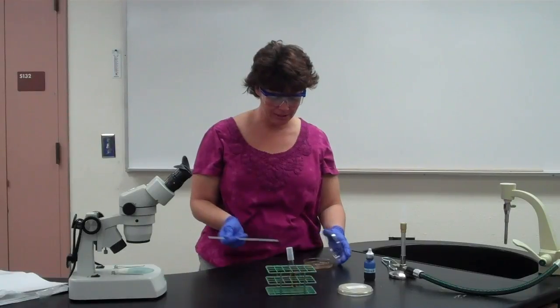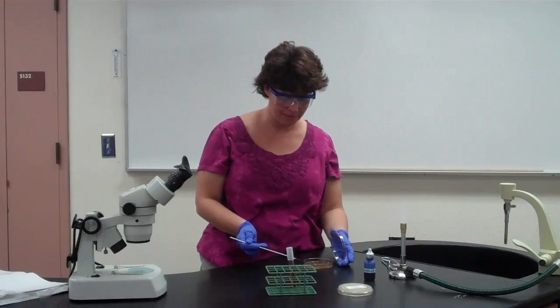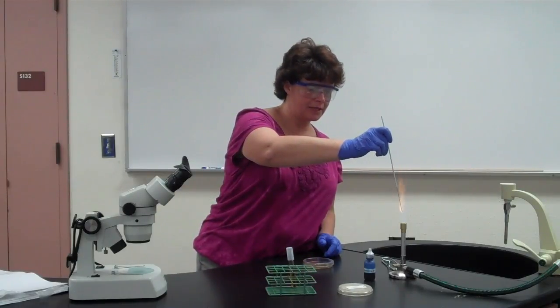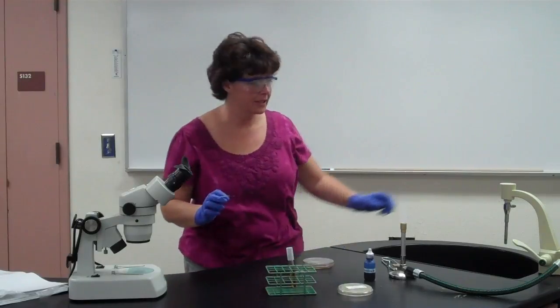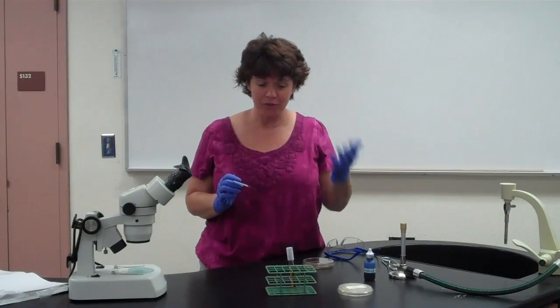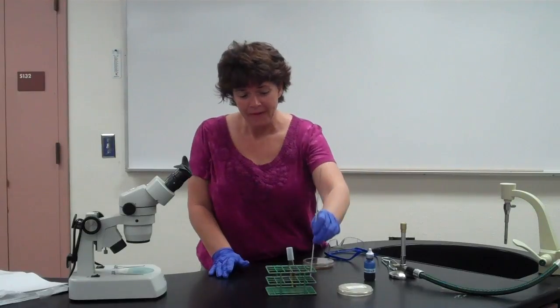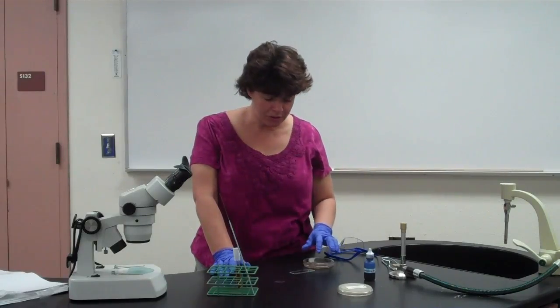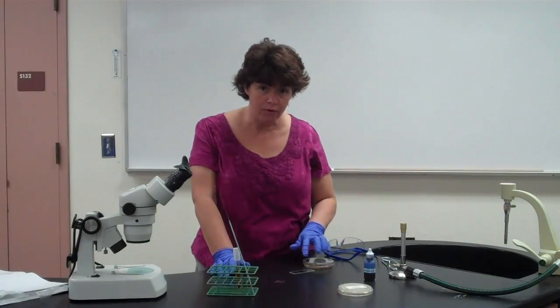And then it says to just gently place that in the middle. Okay, and that's it. You don't spread it, you don't push it down. The other thing is the word gentle needs to be emphasized, because the spores themselves will break and the hyphae will break, so you want to be gentle because you don't want to disrupt that. And you'll probably notice when we look at the yeast that it spreads pretty quickly. So what should happen is the mold should actually grow from that center point, so it should spread out. That's why you don't spread it, because if you spread it all over, you just end up with this huge plate full of mold. Okay?